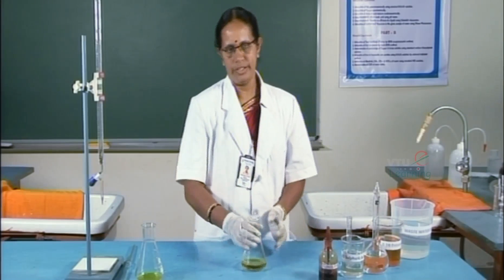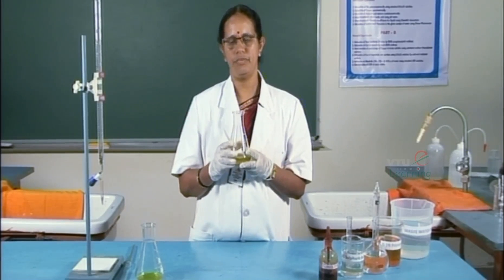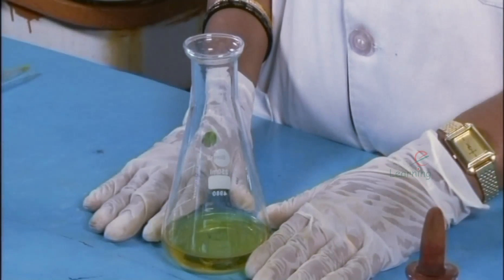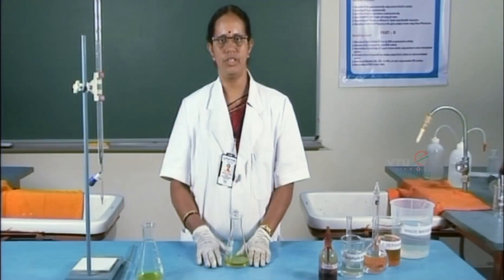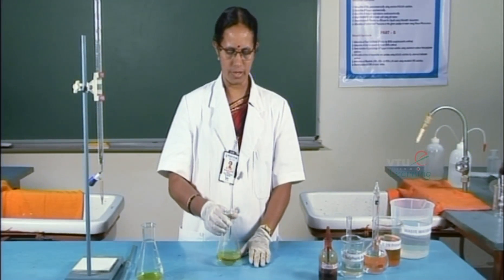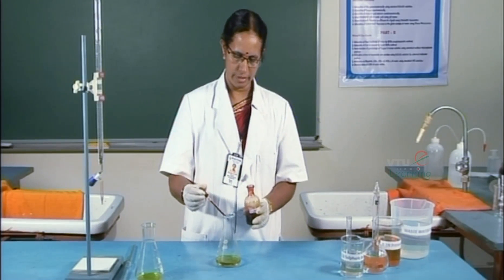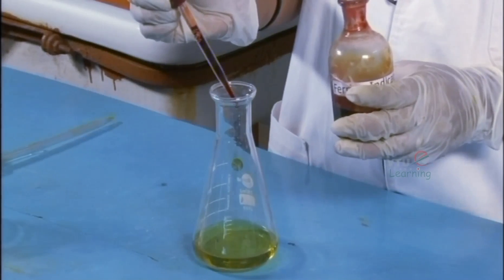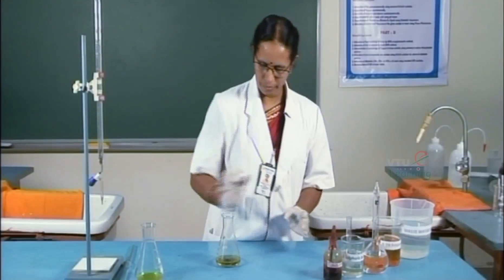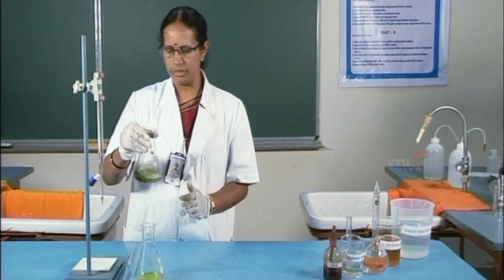To the contents of the conical flask, boiling chips are added and the solution has to be refluxed for half an hour. Now the solution is ready for the experiment. To this, 3 to 4 drops of ferroin indicator is added. The solution turns greenish color.